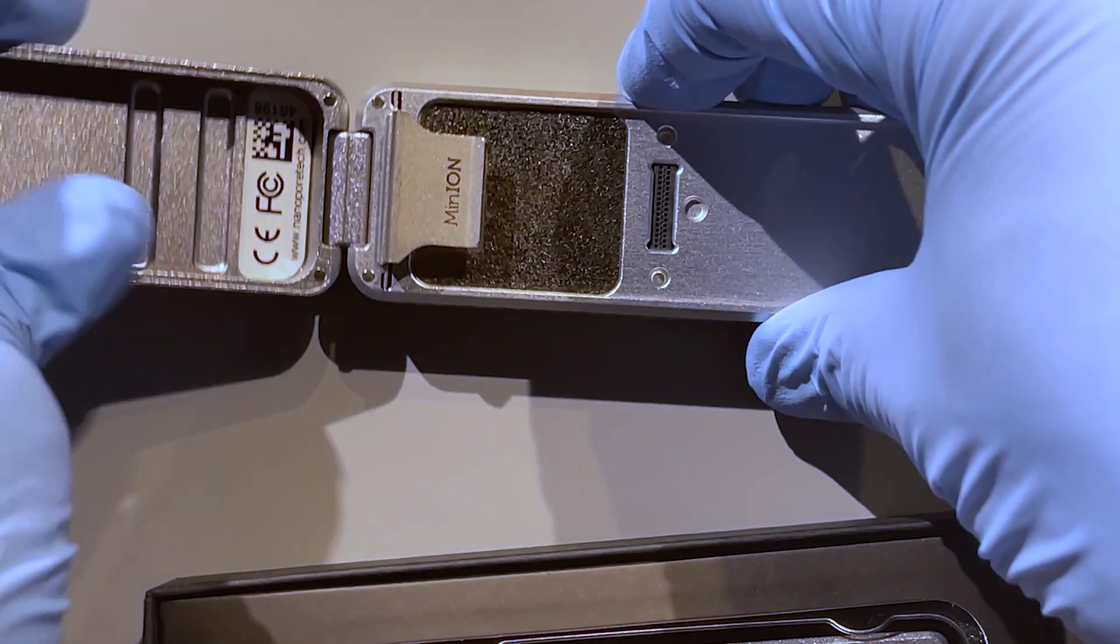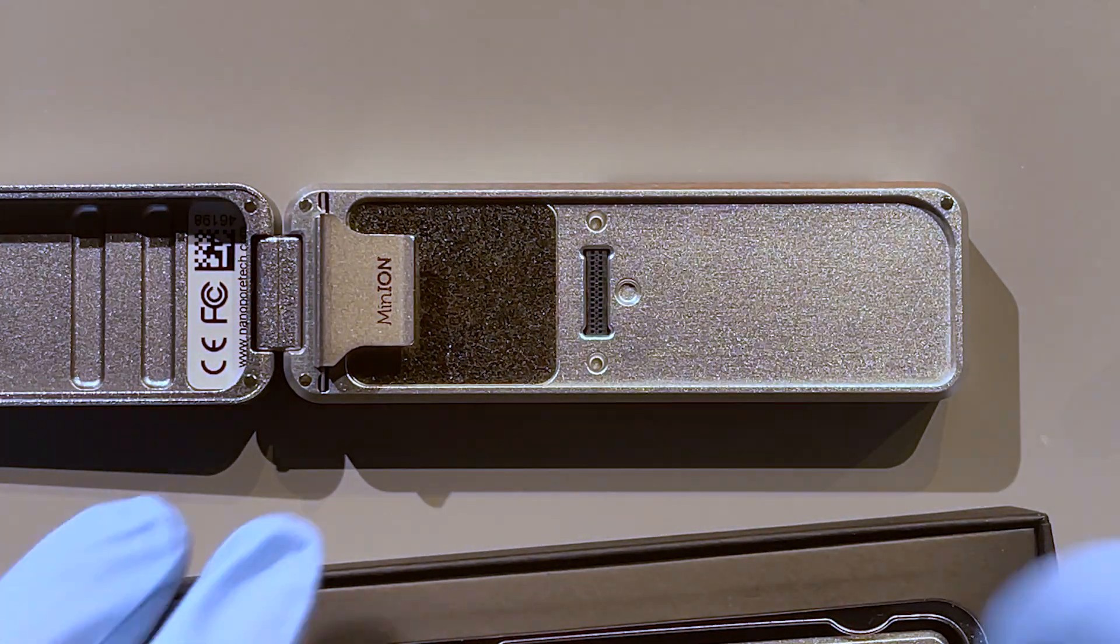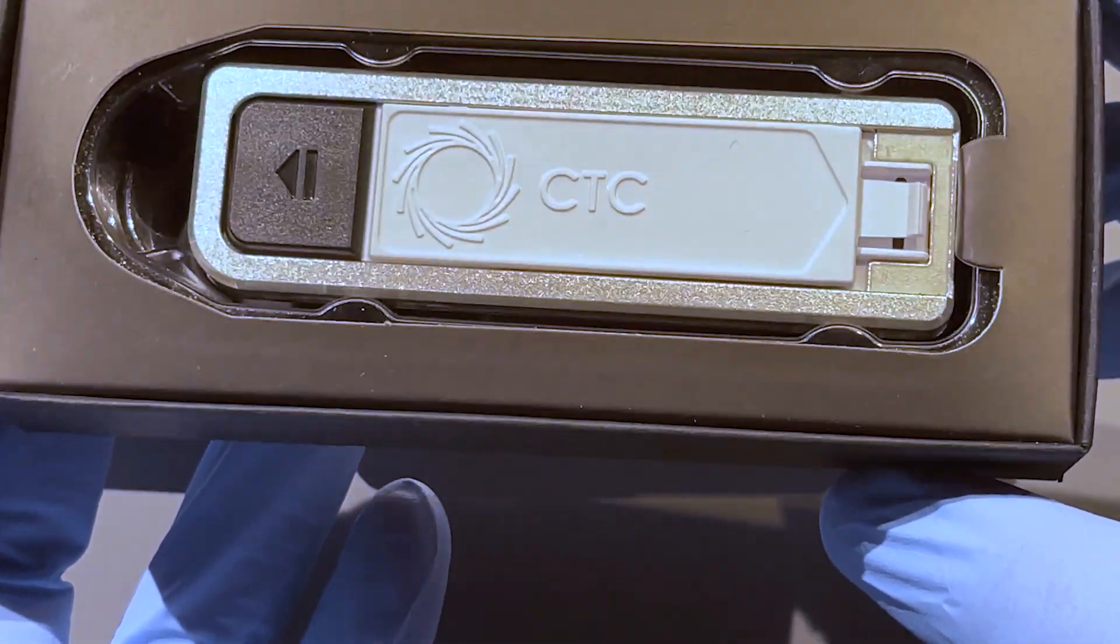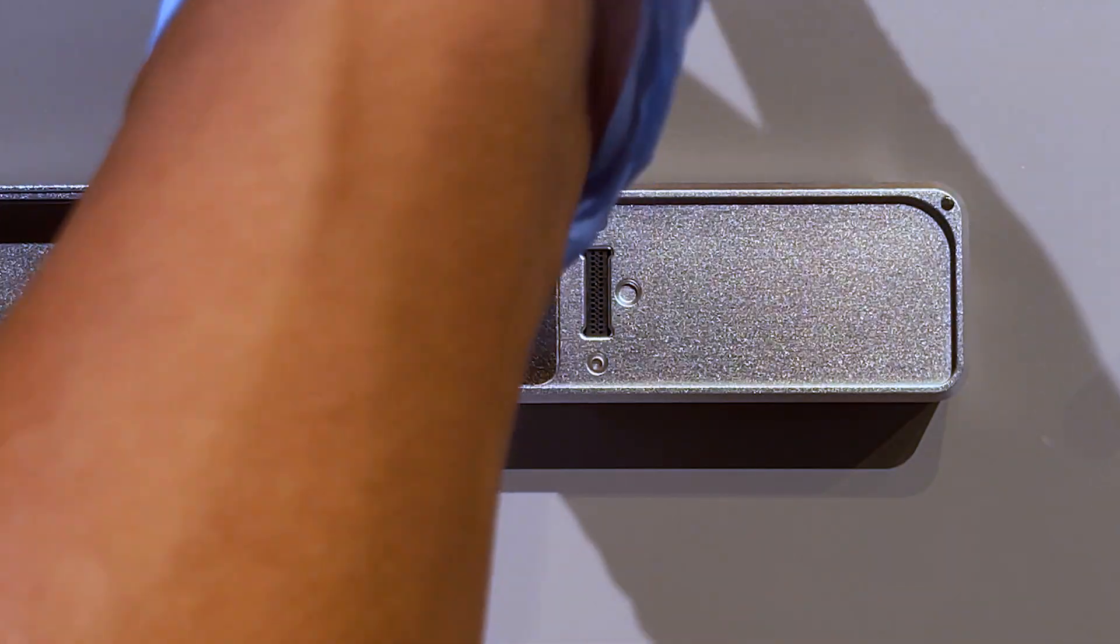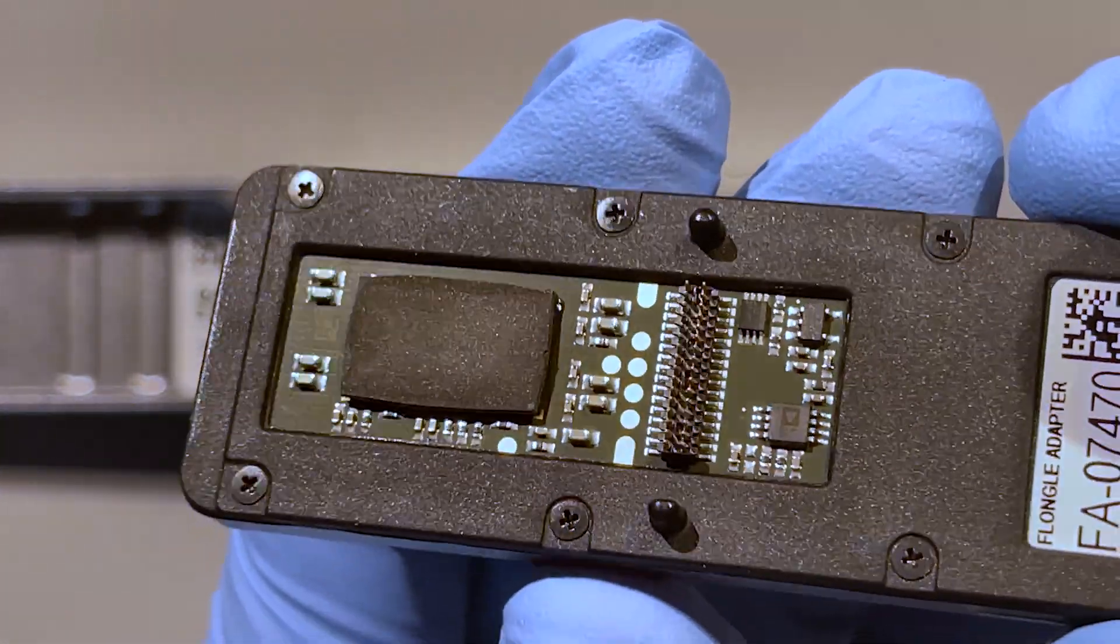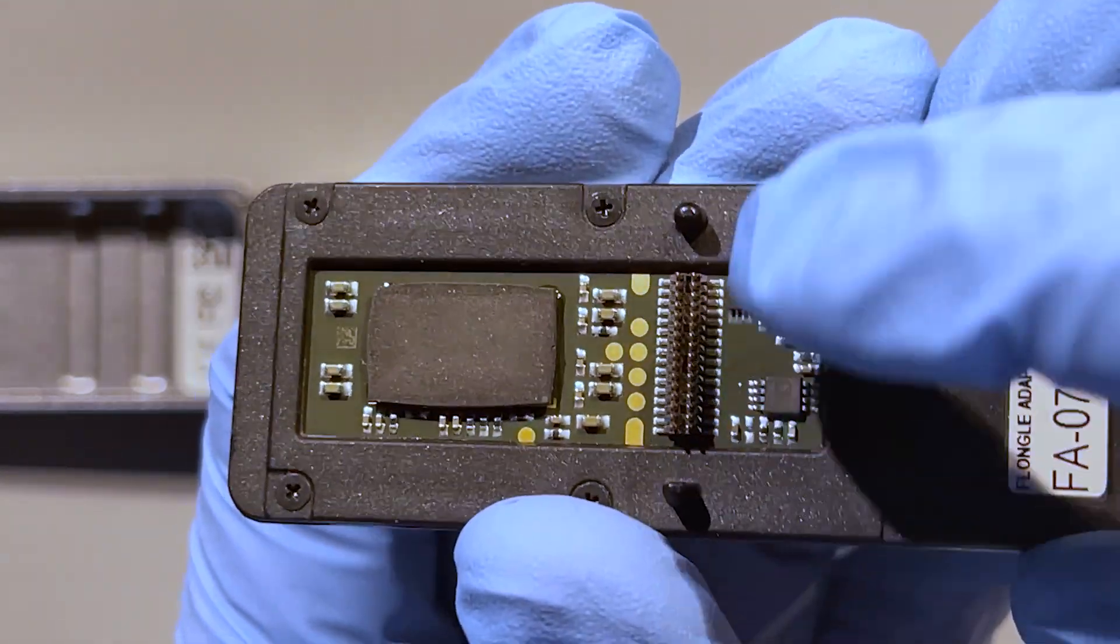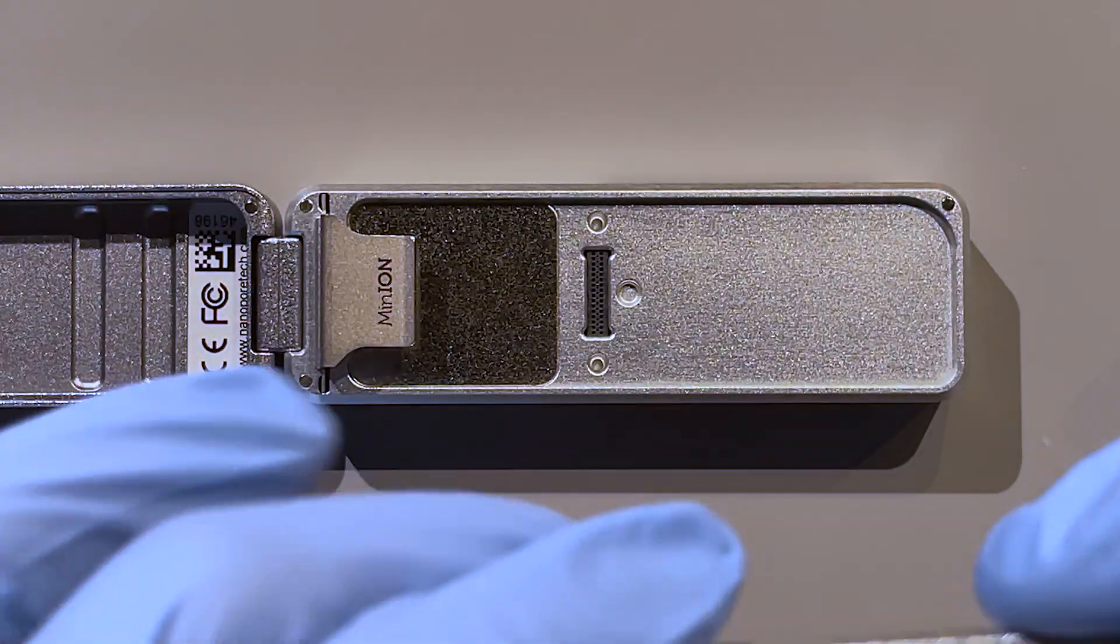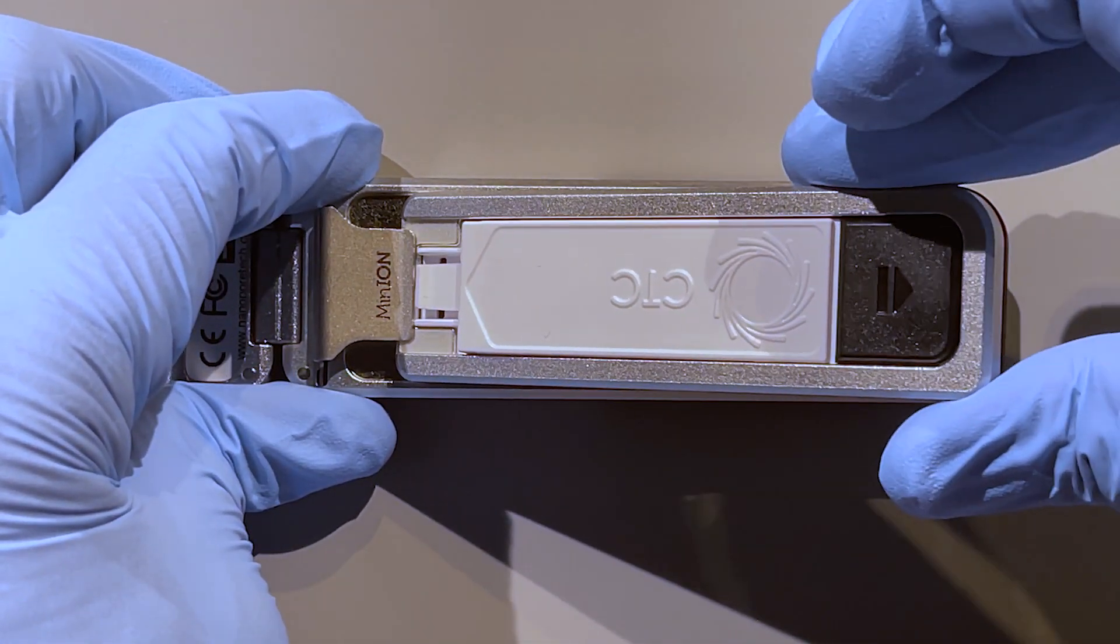I'm ready to load. I've got here my MinION device, and I can open that up. Let me try to position it. I also have one of the flow cell adapters, so I definitely need the adapter inside when I have that. You notice—don't touch the electronics that are on the back. We don't want to touch any of those, but also if you notice the arrangement of the pins there.